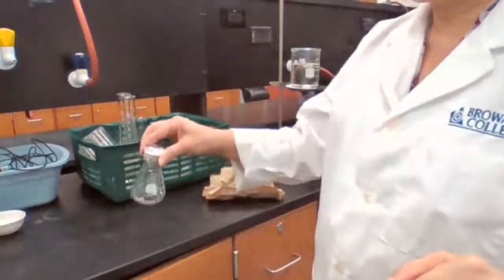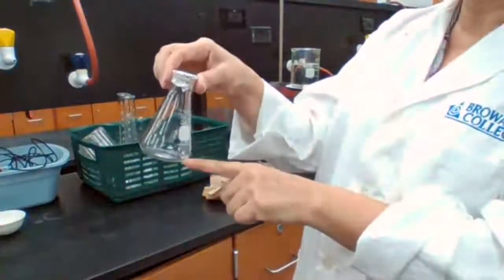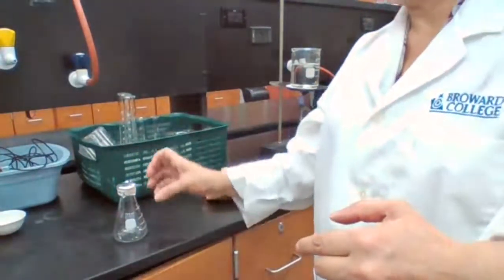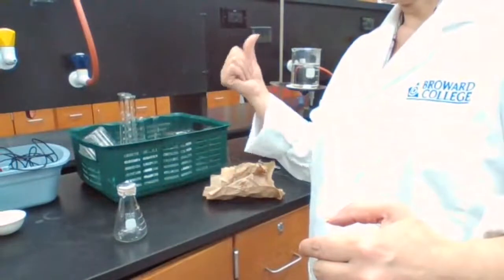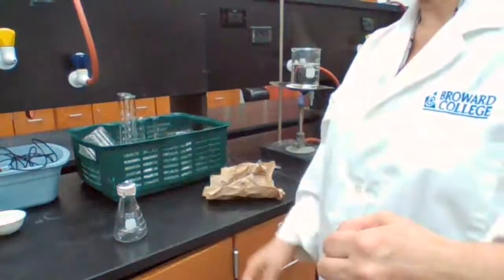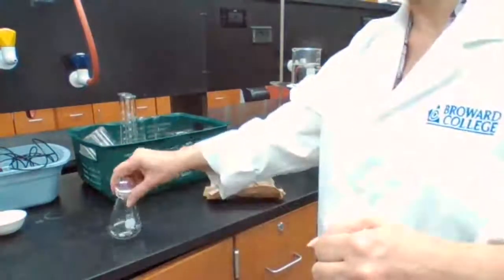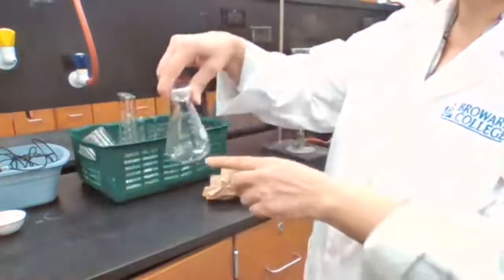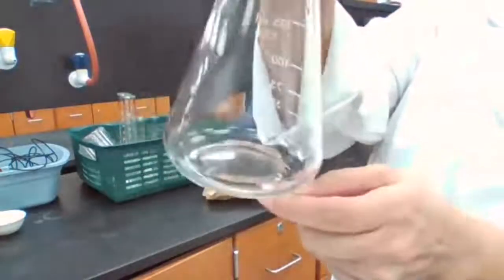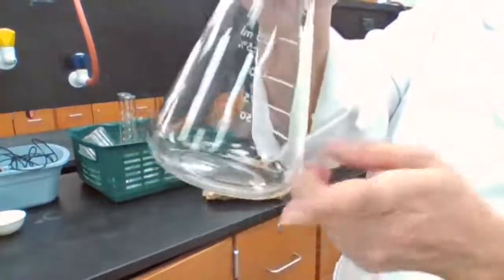I see, like sometimes I see condensation coming out, but it's okay to have condensation because the vapor, when it's in high temperature inside the beaker, is in gas phase, but when we take it out, it condenses, it comes to liquid. So it's okay to have some condensation and the liquid around the stone at this point because the stones are not moving around anymore because it gets some condensation. That condensation is all right, and it's supposed to be as long as it was dry before. So if it's dry before, now there's like a little bit of a drop in there.